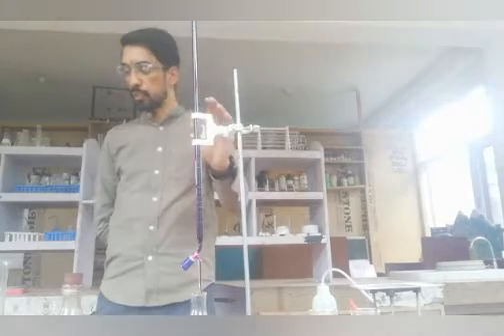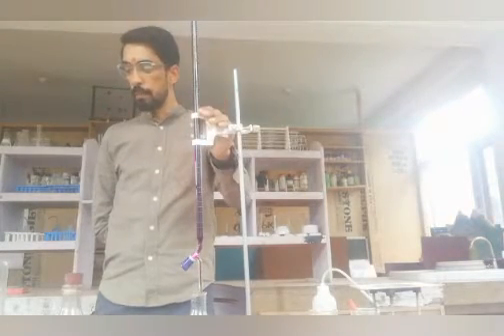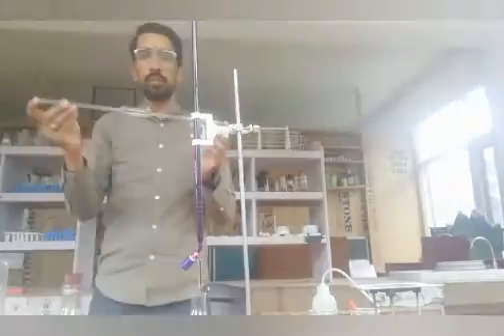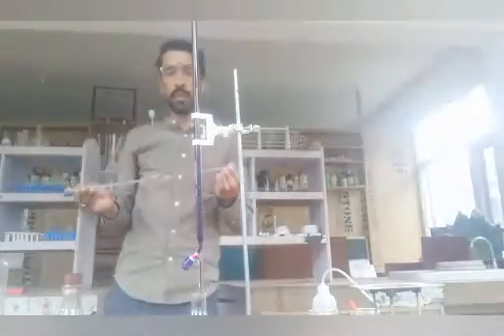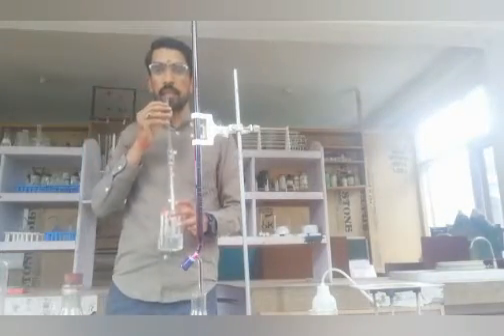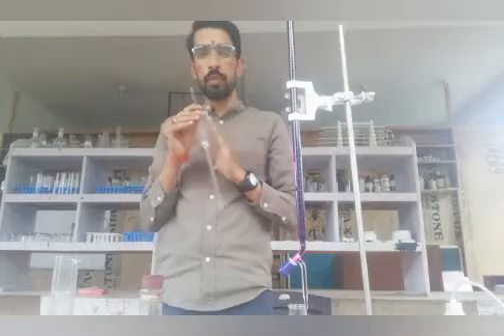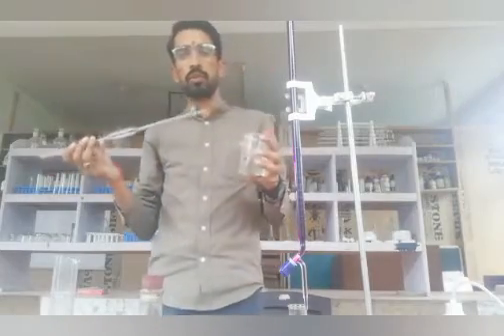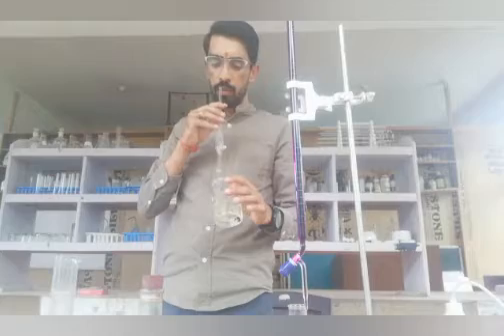Now we pipette out 20 mL of Mohr's Salt solution into the titration flask. For that purpose we use a 20 mL pipette — you can see its shape. We will rinse the pipette with water first to learn the technique: we need to suck the solution up to the mark, just like sucking through a straw. When you release the opening, the water runs out automatically due to air pressure.